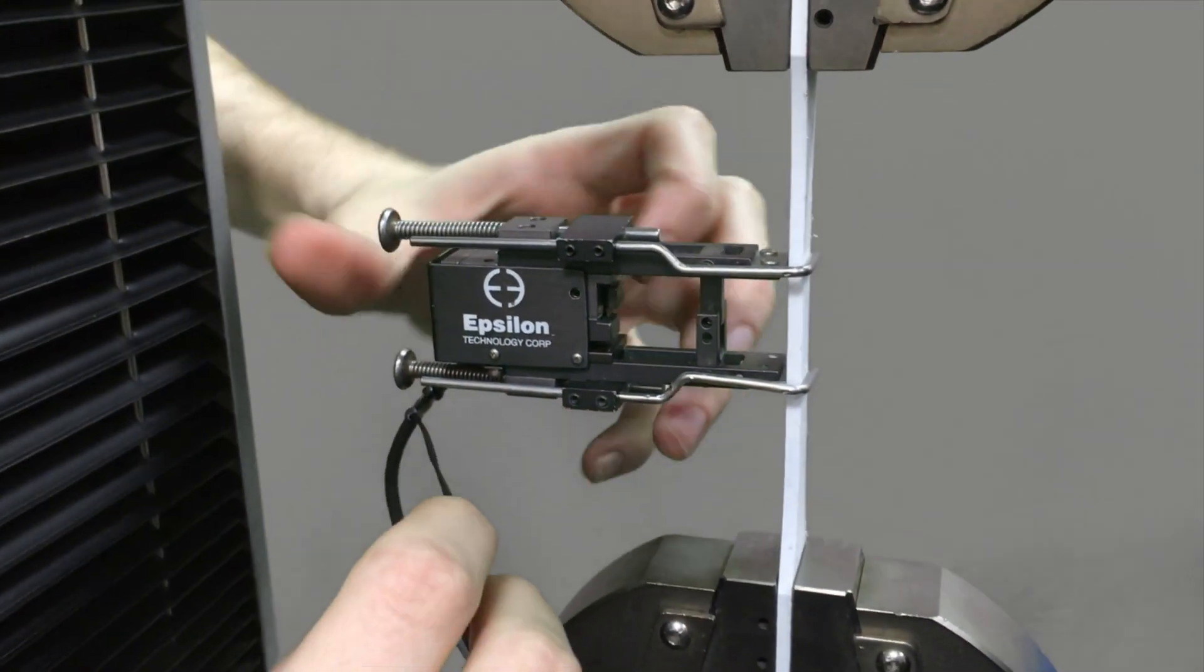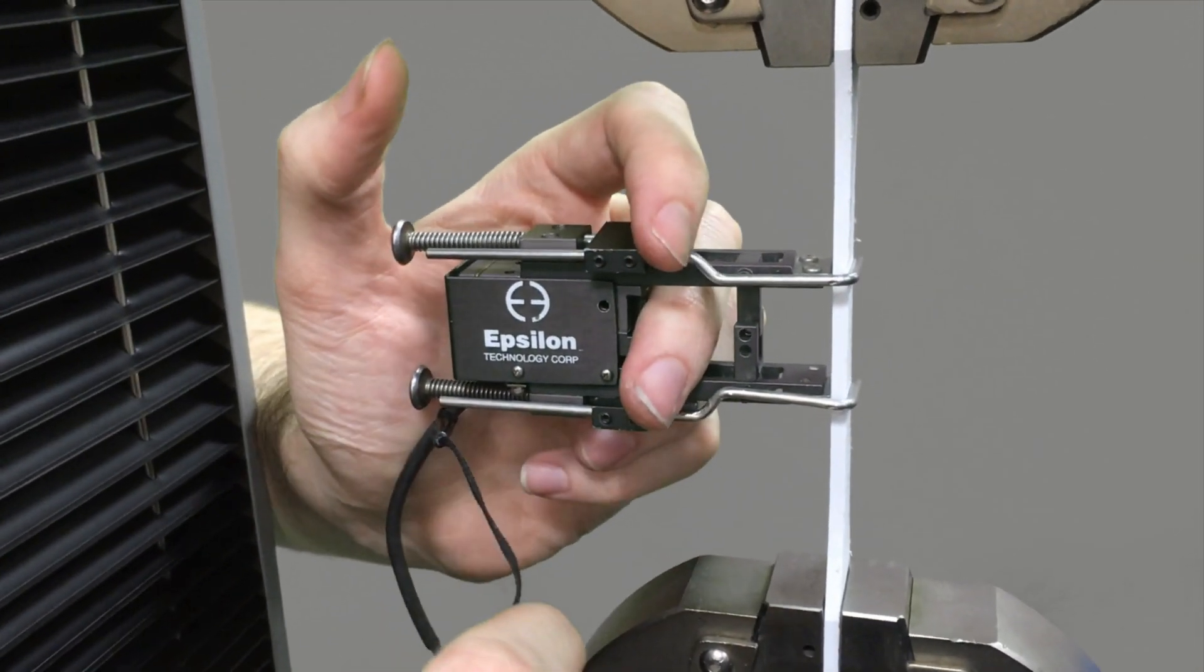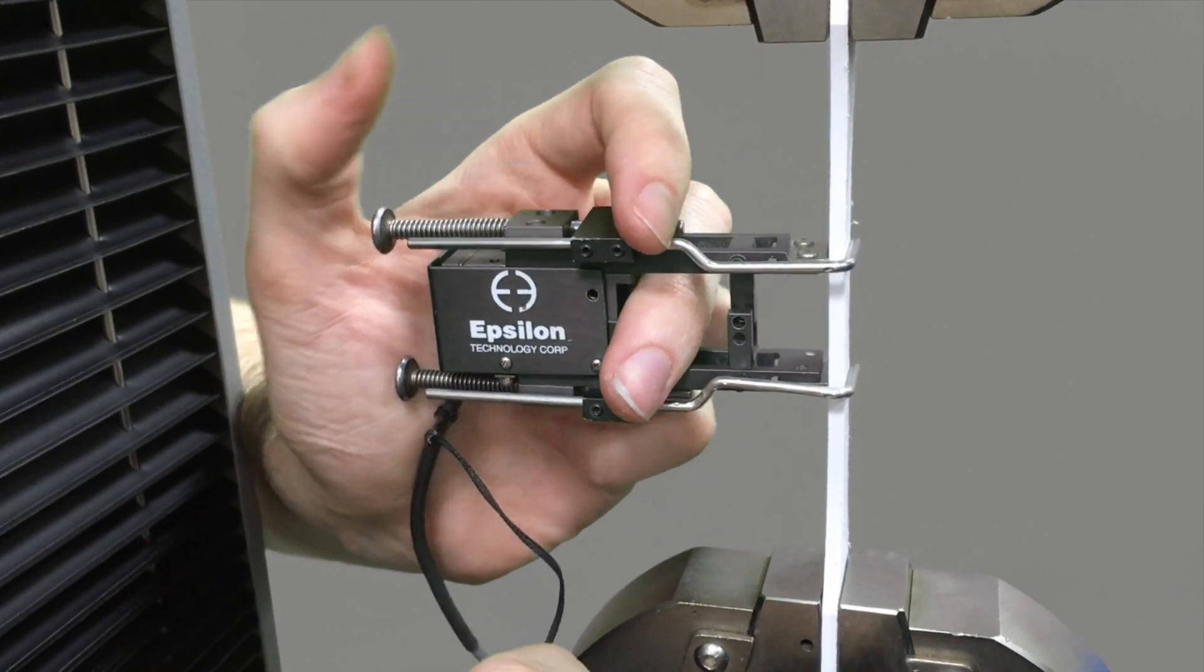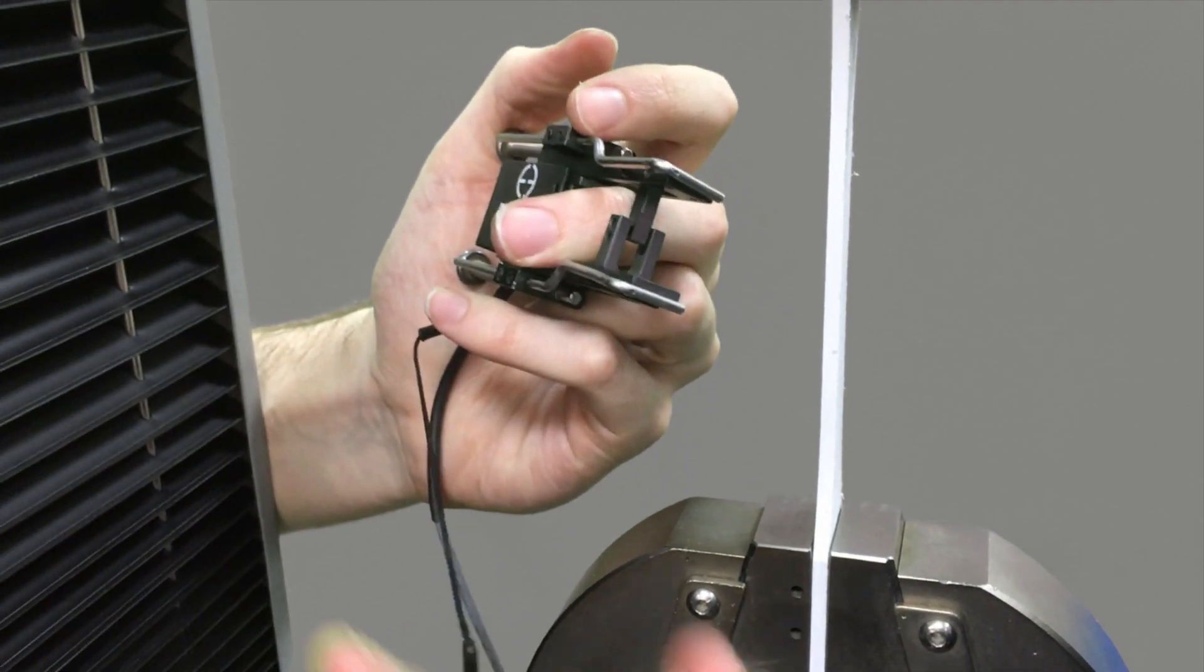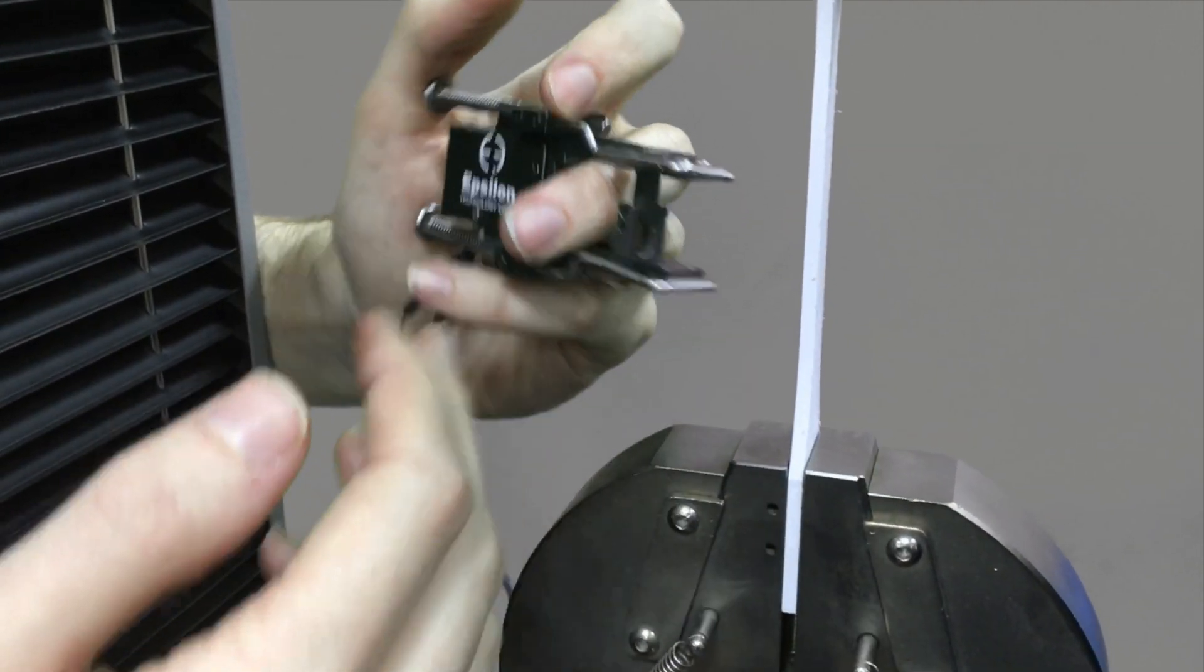One common mistake when taking these off after a sample breaks or you're ready for a new sample is forgetting to put the pin back in after setting it back up on a new sample.